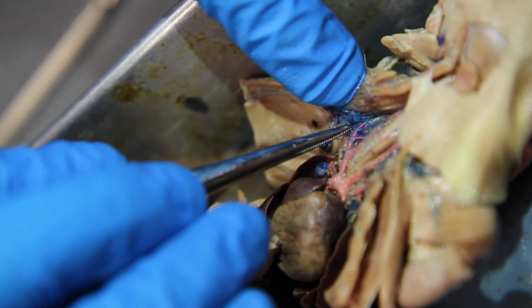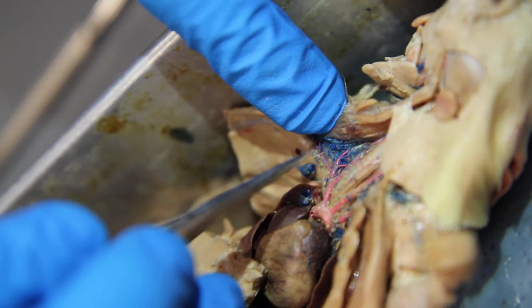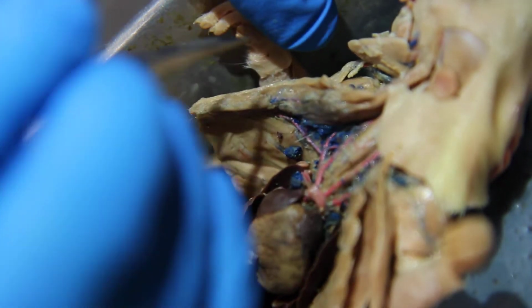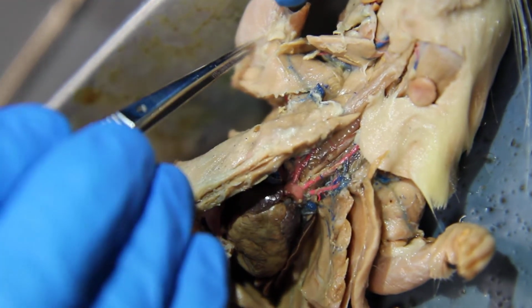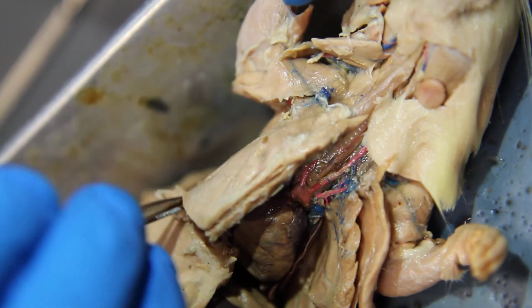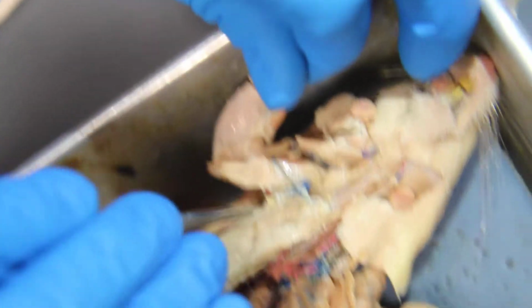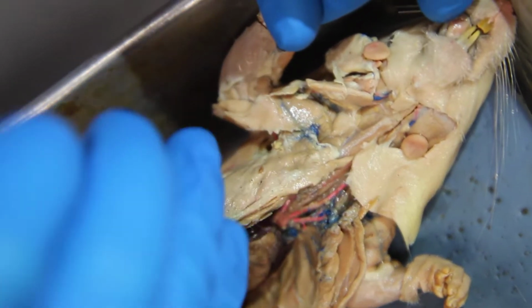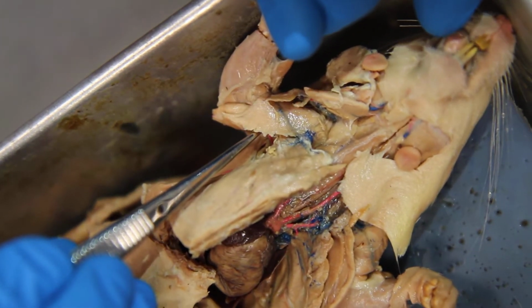Does everyone see that, how it forks off? I can't really get the blue away, but it forks off, and that one's called the axillary artery. And that one goes through the body wall, depending how good this rat is. It goes through the body wall, and then it splits into a brachial artery and an external thoracic artery, or lateral thoracic artery. Do you see this artery right here? That's the lateral thoracic, and it's breaking off up here somewhere. This one is the lateral thoracic artery, and this one over here that's going to the arm is the brachial artery.